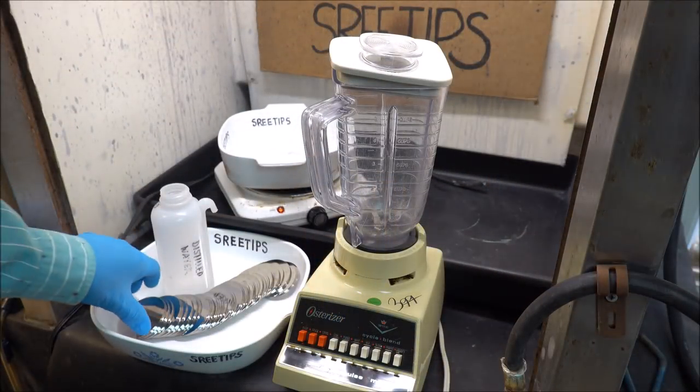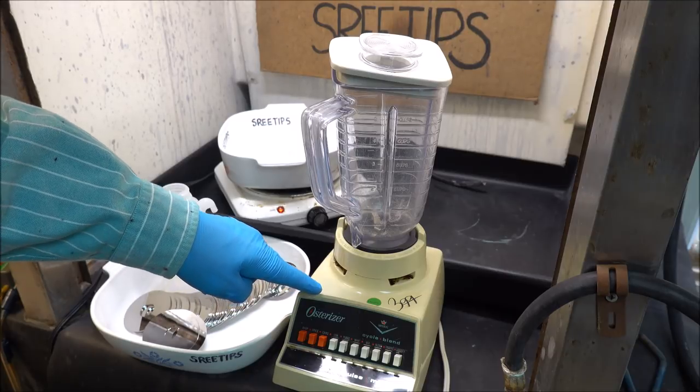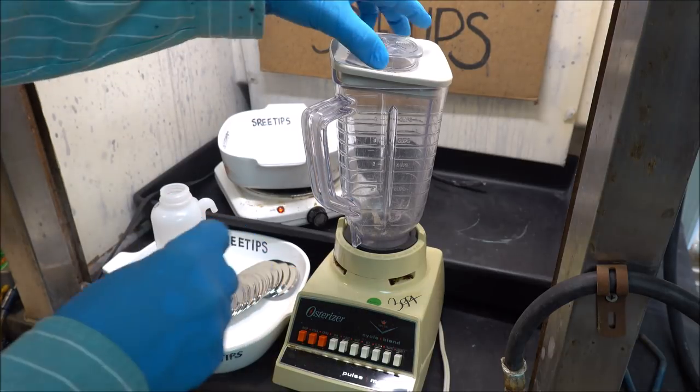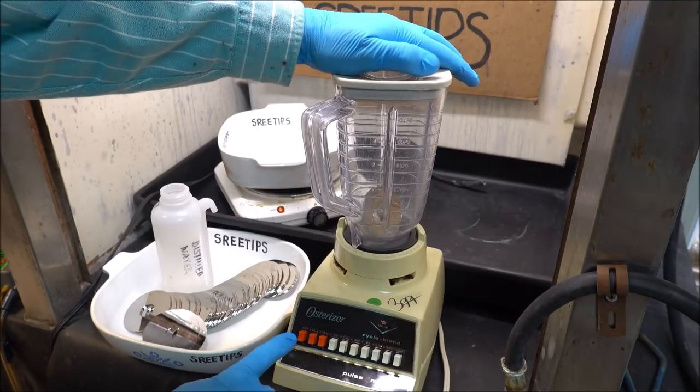I'm going to take one of the disks, I've got an old blender here that I bought at the thrift store. I'll drop the disk down in there, turn this thing on and see what happens.